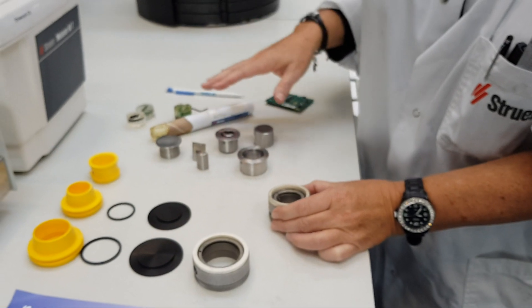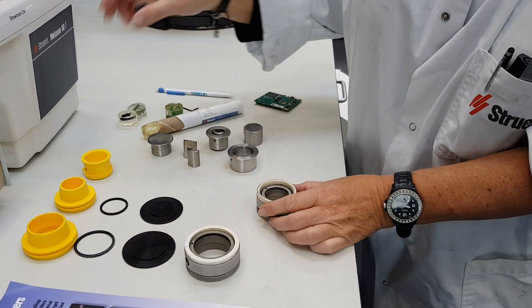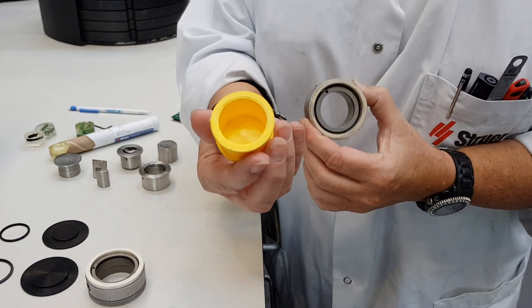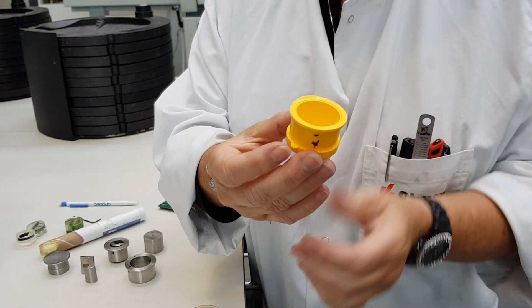There are a lot of different accessories — inserts, special forms. The most general one used is the seriform. The seriform has cylindrical sides and therefore makes a very perpendicular sample.